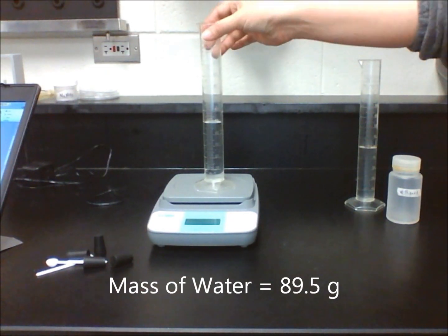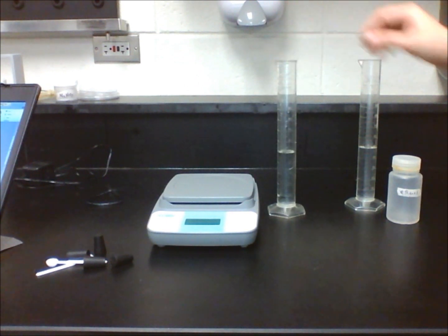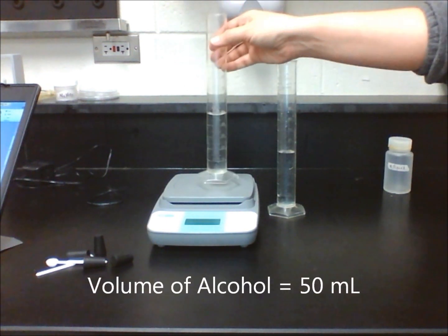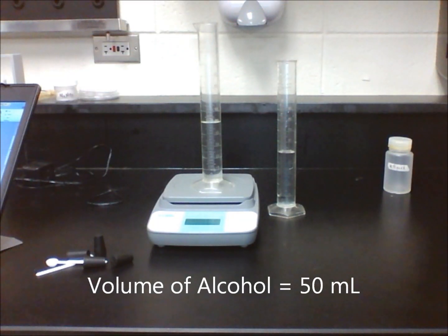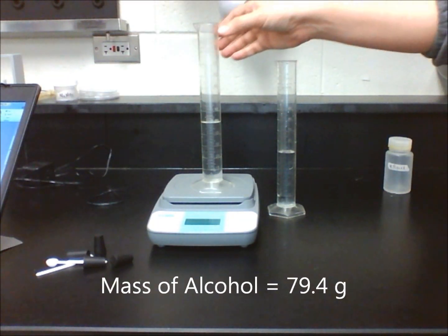Now, put exactly 50 milliliters of ethyl alcohol into the other graduated cylinder. Measure the mass of the cylinder and its contents. Record your results in Table 1.